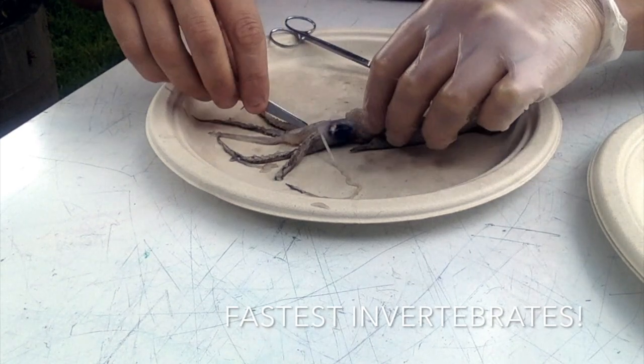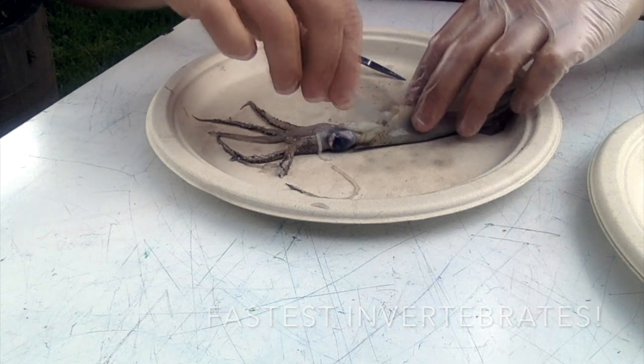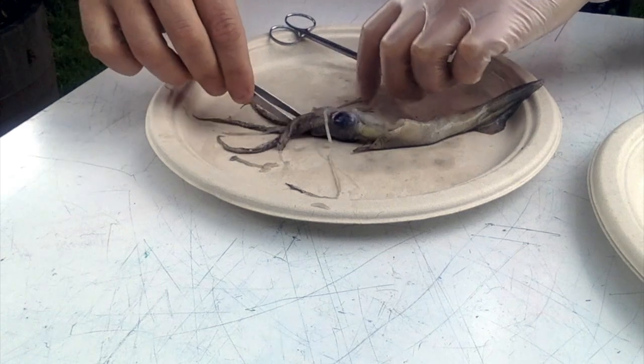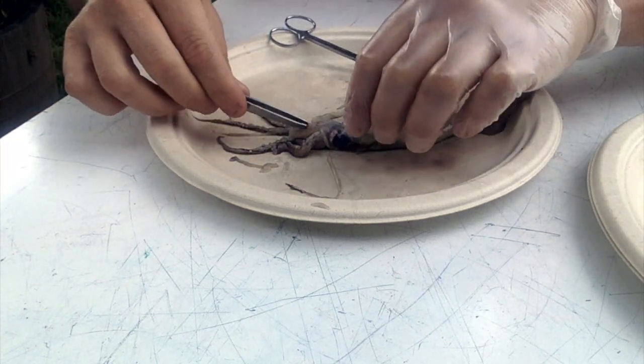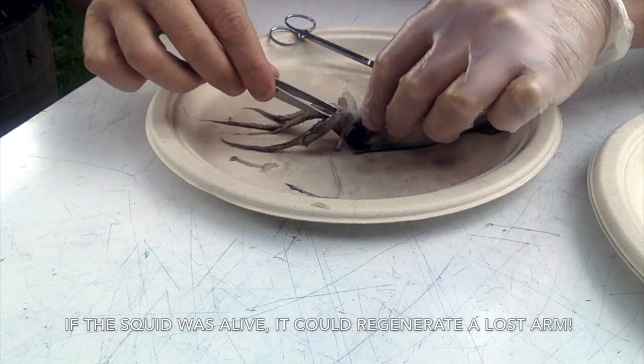So no backbones. And so all of the major other organs are going to be up inside of this cavity. So we'll be able to get to those here shortly. Unfortunately, in the freezing and thawing process for this squid, we lost some appendages here. So yeah, they're not doing so good.